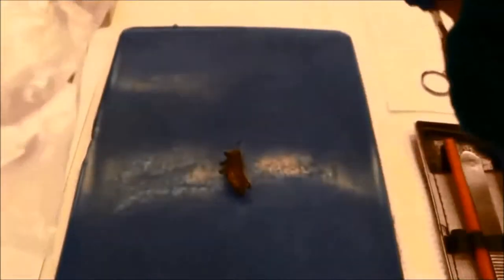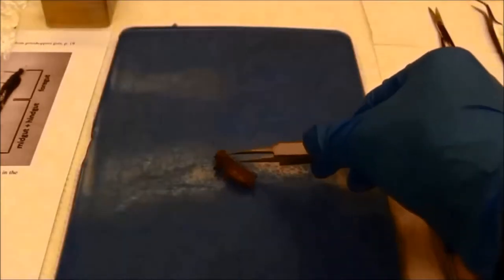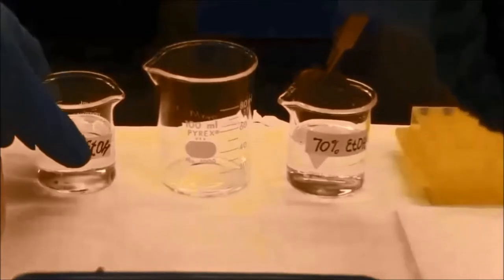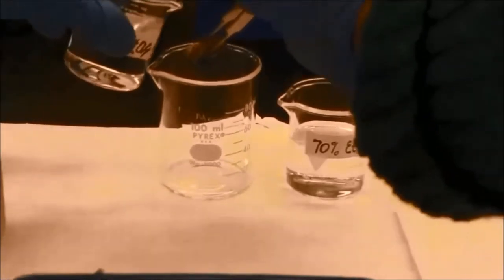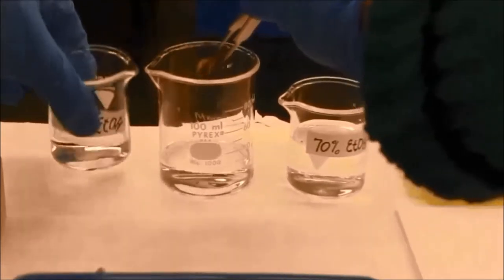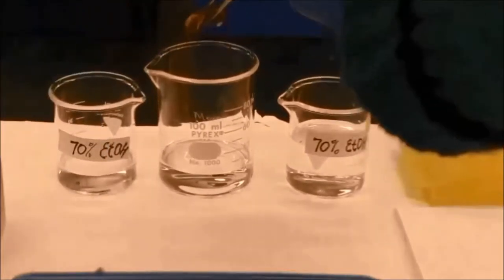First, I need to take a frozen grasshopper from the freezer and rinse it immediately with ethanol. This step will clean all plant debris from the external surface of the grasshopper and prevent the amplification of non-host plant DNA.